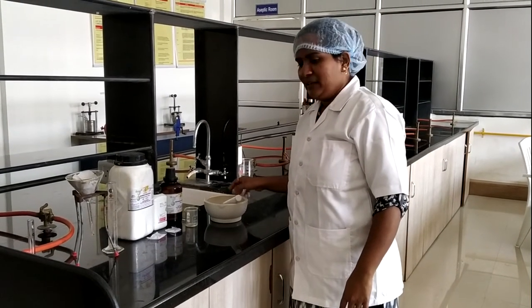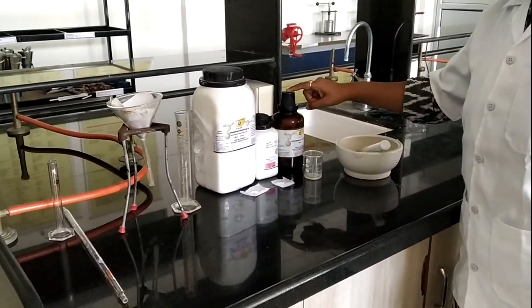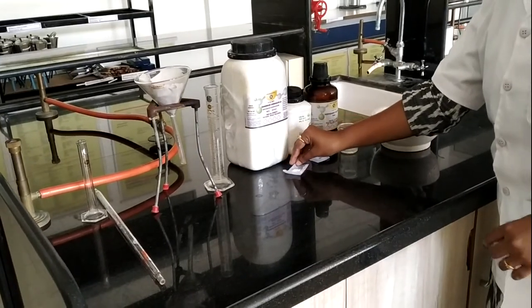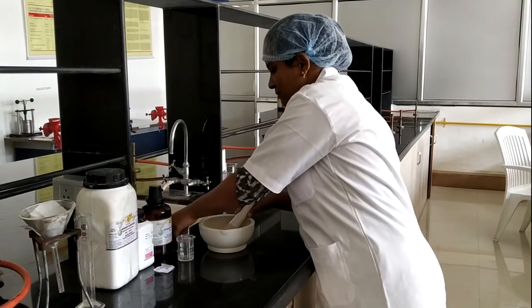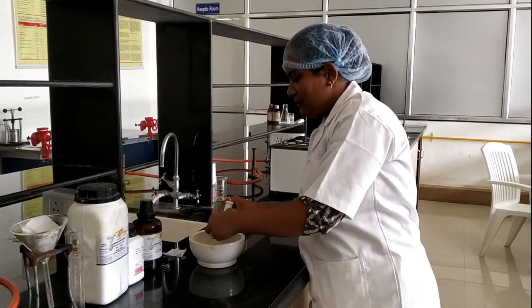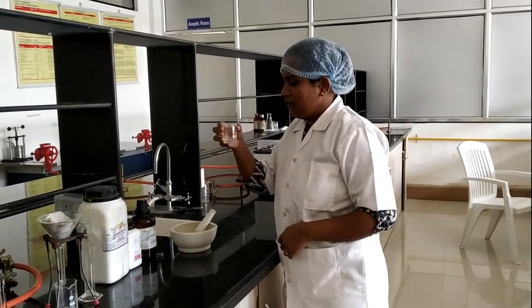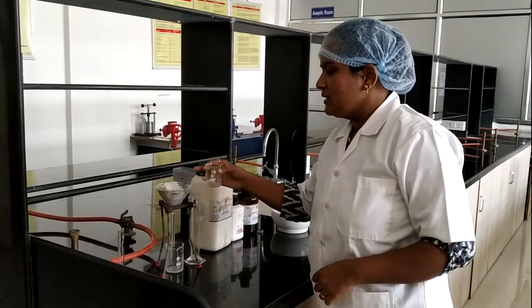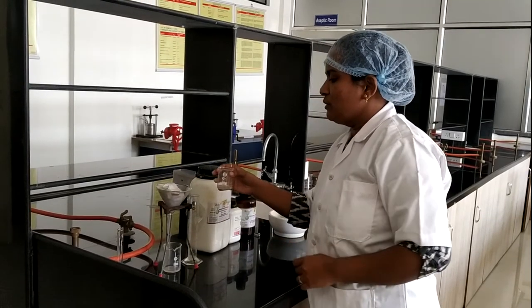Now let's move to the laboratory to perform the actual experiment. We have the chemicals for this formulation: magnesium carbonate, magnesium sulfate, and peppermint oil, from which we prepared peppermint water. In the first step, we add magnesium carbonate in water and peppermint oil for trituration, then add magnesium sulfate in water and peppermint oil, and then add peppermint water. After trituration, we take the solution into the beaker — some particles are visible — so now we proceed with filtration. Filtration must be done through muslin cloth, or a filter paper of the same grade and pore size. We now proceed with filtration.